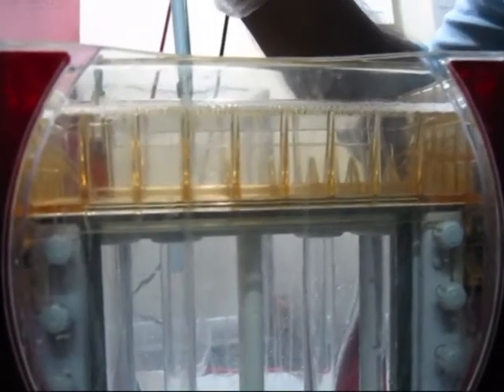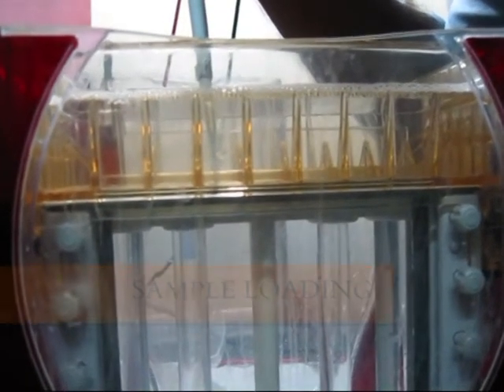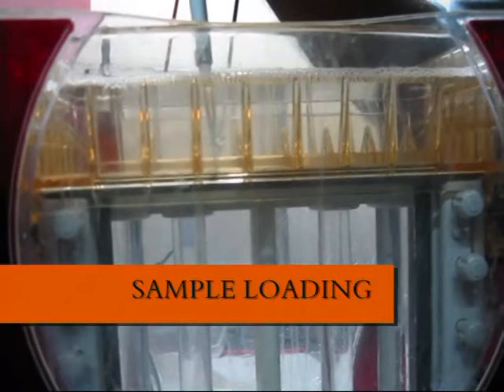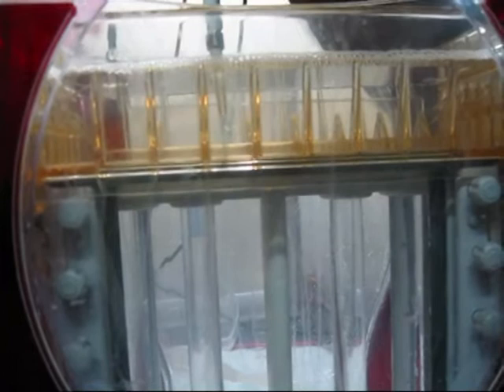Loading of sample. Bromophenol acts as a tracking dye. Polyacrylamide has a limited capacity for proteins. Overloading results in precipitation and aggregation of proteins, producing streaks and smears. The loading dye consists of beta-mercaptoethanol, which denatures and linearizes the protein, and sodium dodecyl sulfate, which binds to the protein and gives uniform negative charge.